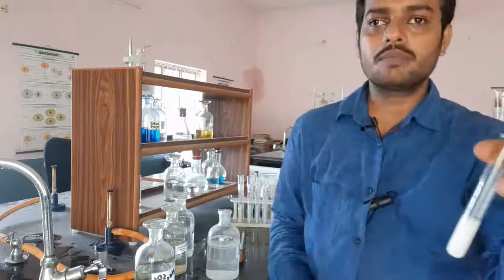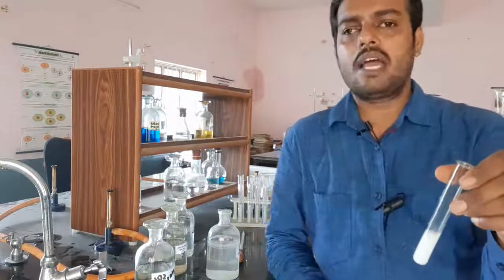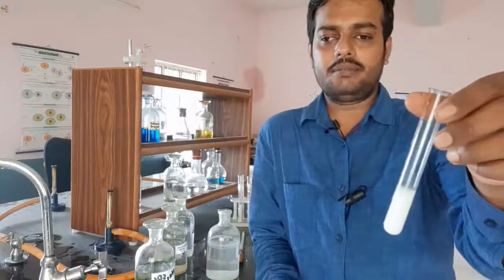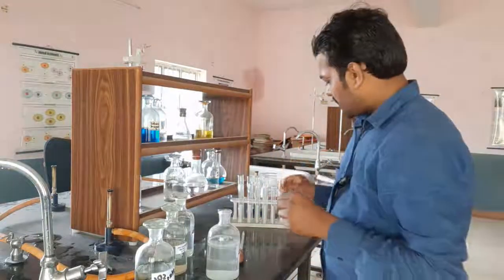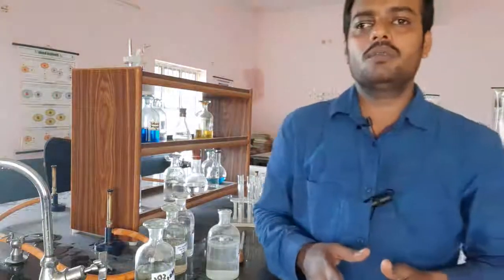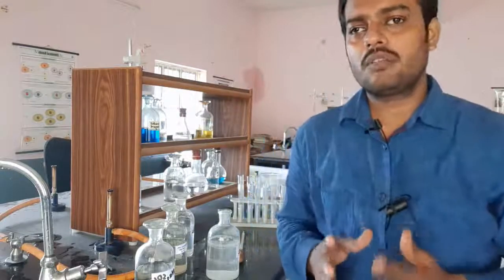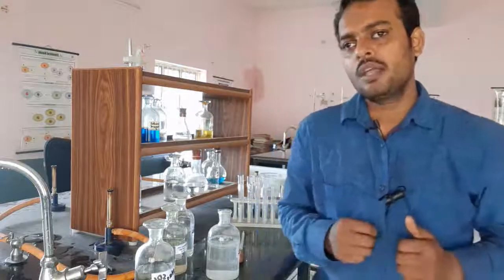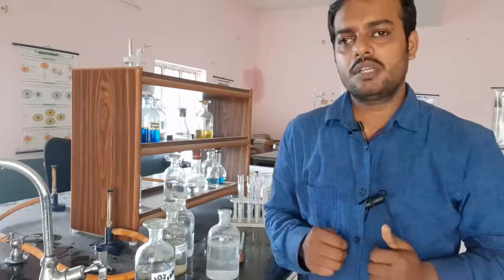We have taken sodium sulphate there, and on reaction of sodium sulphate with barium chloride, we have barium sulphate in the form of white precipitate and sodium chloride in the aqueous medium. So, this reaction shows that the given compound contains the sulphate group, and the reaction of sodium sulphate and barium chloride gave barium sulphate and sodium chloride solution. Okay. The barium sulphate is a white precipitate, which we have seen.